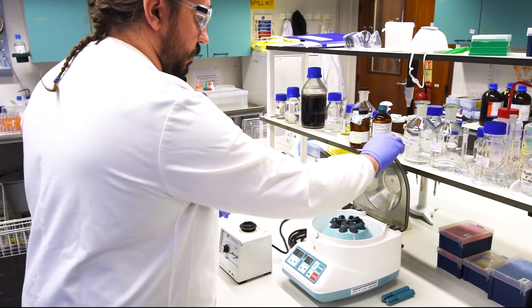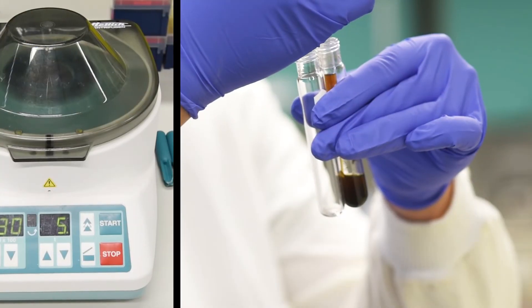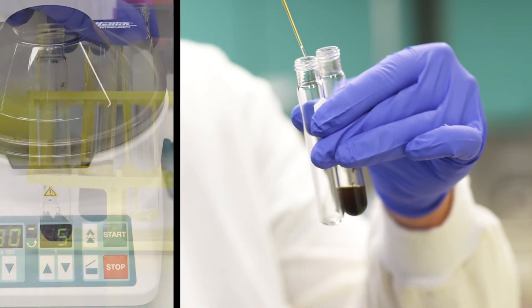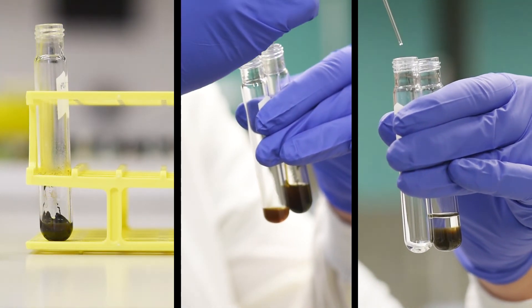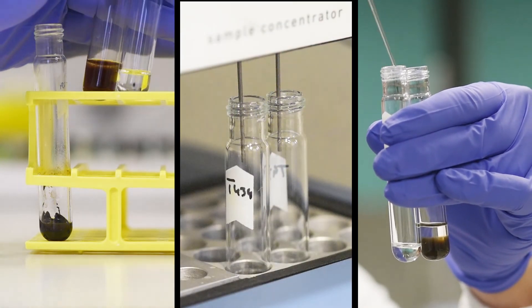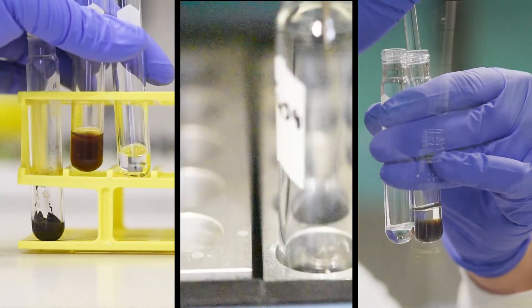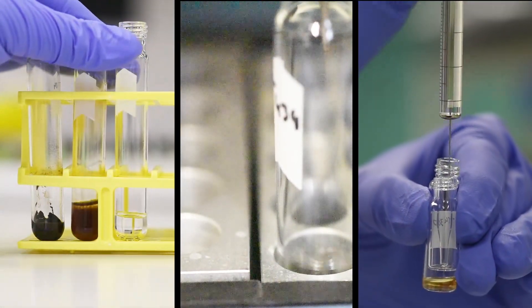Once we have this lipid rich mixture, we separate it out from the ceramic powder until we have an extract that we can reduce and concentrate before starting the analysis.